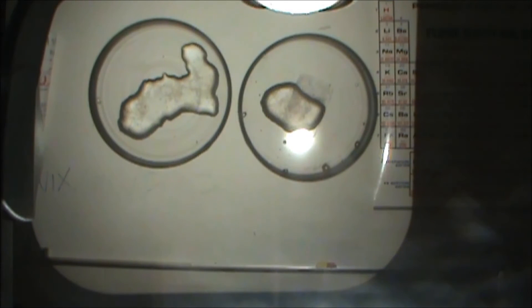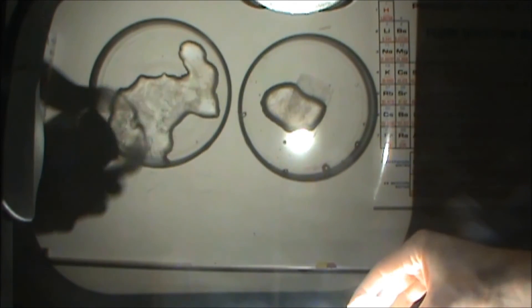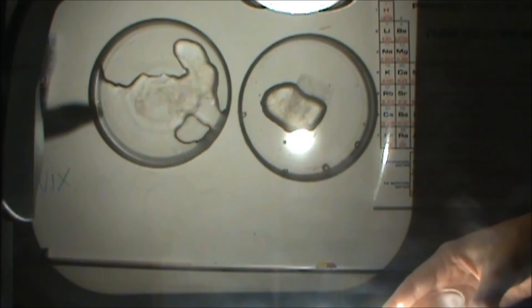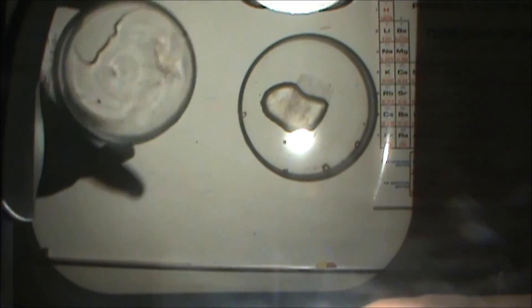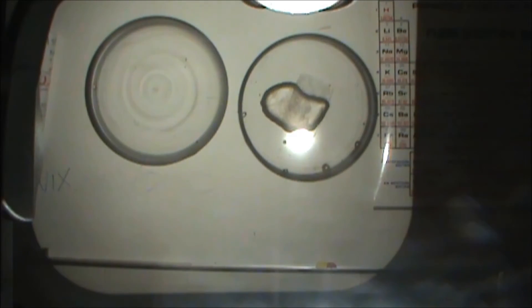So the first thing I'm going to do is take some hydrochloric acid and mix it with this one. And I'm going to try and mix it just over here at first. So you can see that I'm forming the solution over here, and then that's slowly dissolving away the precipitate. And so I still have some precipitate here, a little bit here, a little bit here. But when I swirl it around and let it mix, the acid is reacting with the zinc hydroxide. I end up with a clear and colorless solution. So what we see there is that we have an acid reacting with the base. So zinc hydroxide is therefore acting as a base.